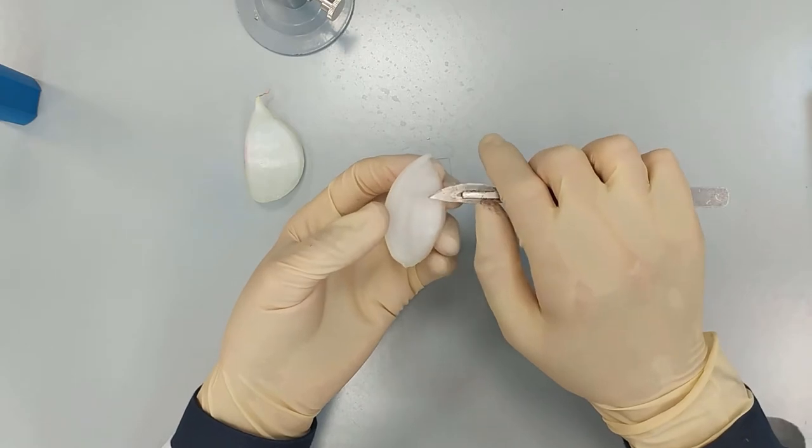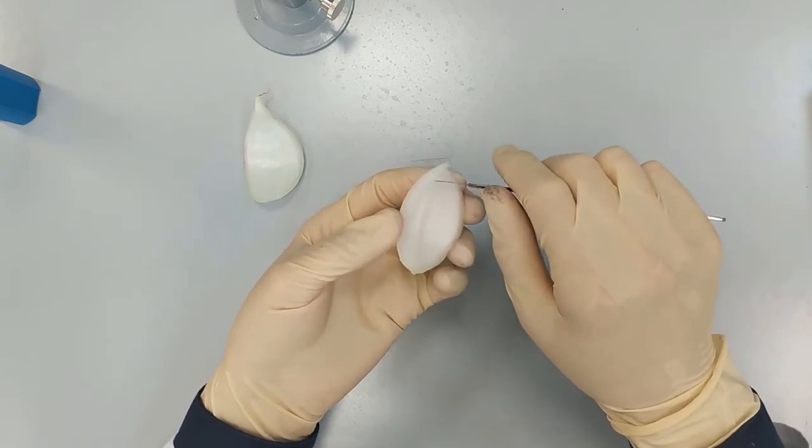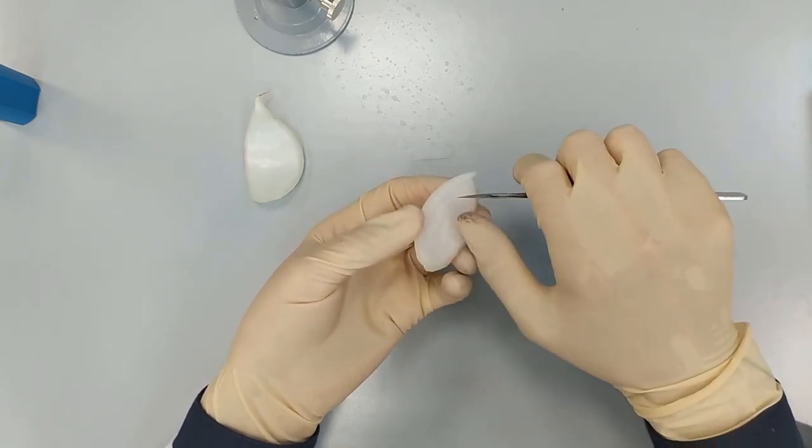So we take this small part and we start peeling it.